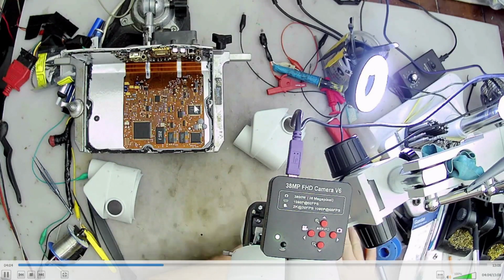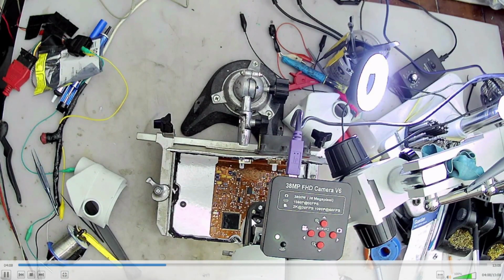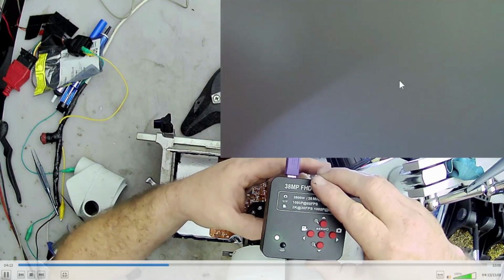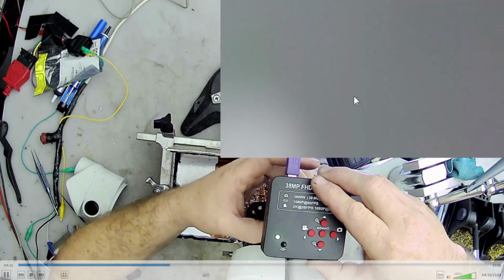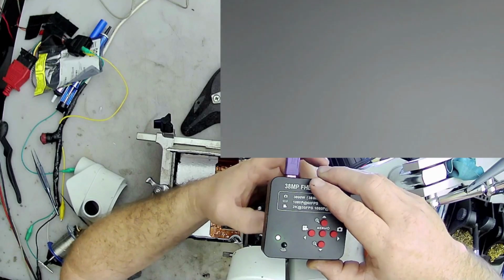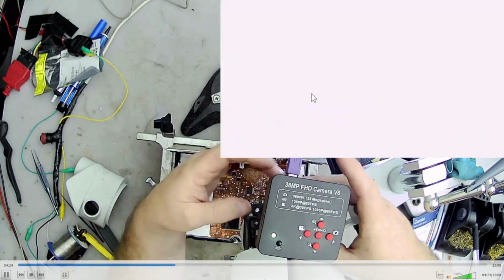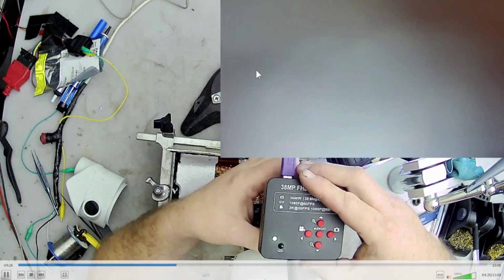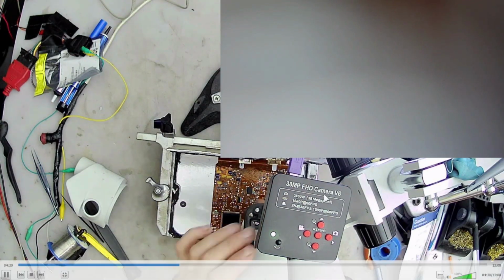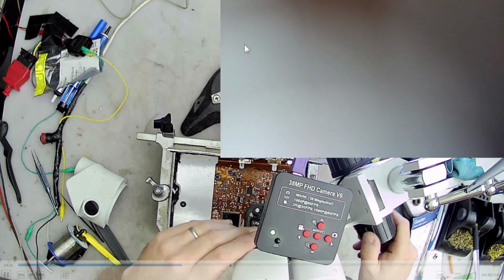Okay, so what I'm going to do here is I'm going to try to line it up. I'm going to use this computer here so I can look through my eyepiece and line everything up straight. And when it was turning, I noticed that if it wasn't turned right, it would be all black on one side, or it would have like a black shadow in it. So I was pretty sure I could line it up like this. And seeing this white, I kind of realized quickly that there's just too much light.